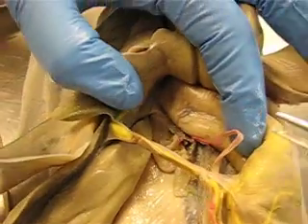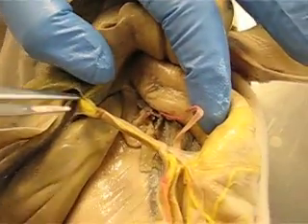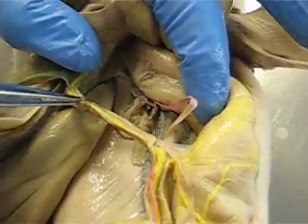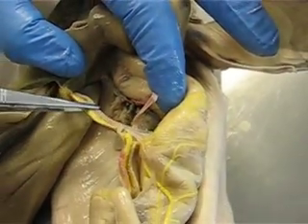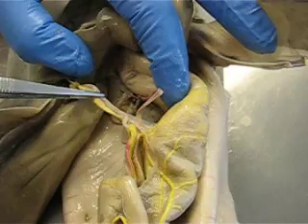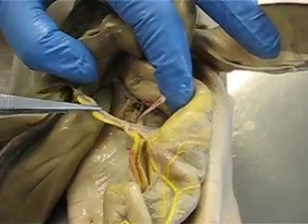This is the celiac artery. This is the hepatic portal vein — it's yellow. There's a pink one that runs along with it, and that's the hepatic artery.